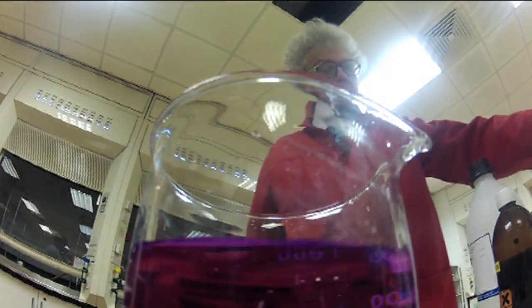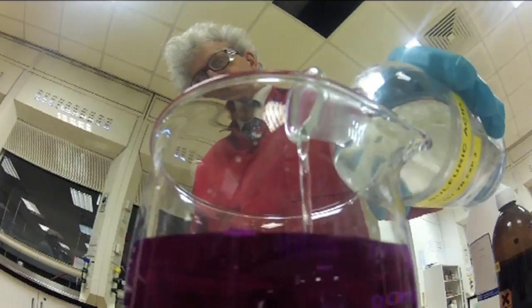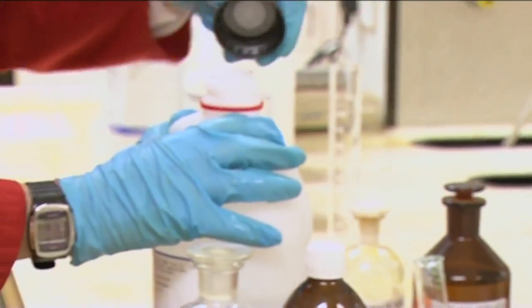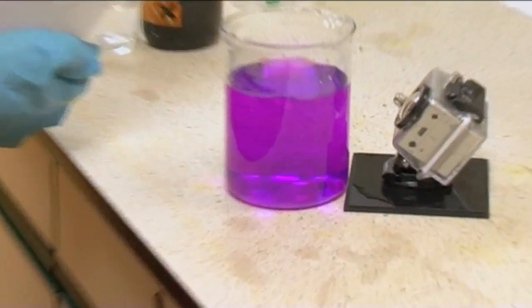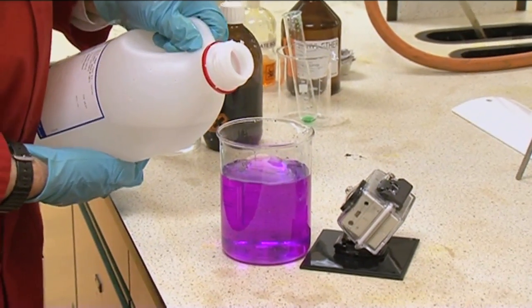We now add a little bit of sulfuric acid. The acid doesn't change the color at all. So you can see now we've got some nice purple potassium permanganate, and now we will take some hydrogen peroxide. Sam had a big bottle that needs to be used up, and we'll add it and see if we can see anything happening. So watch carefully.